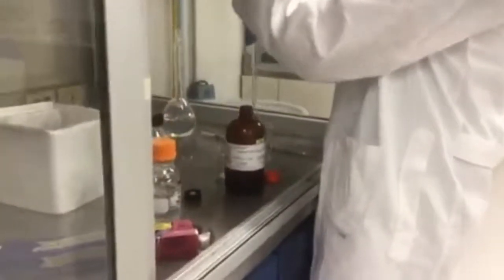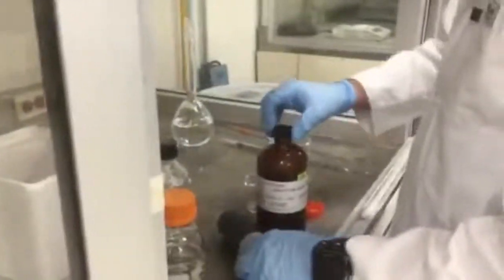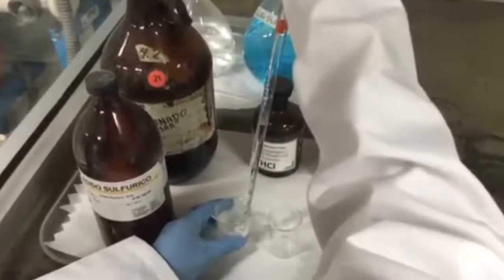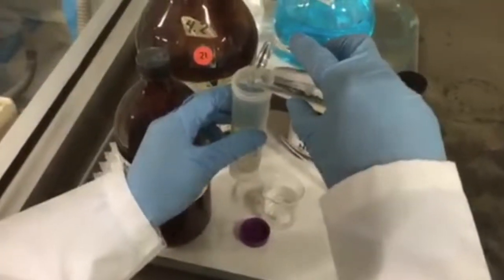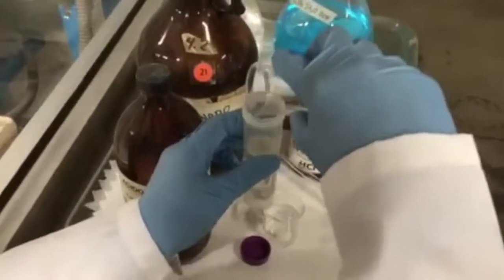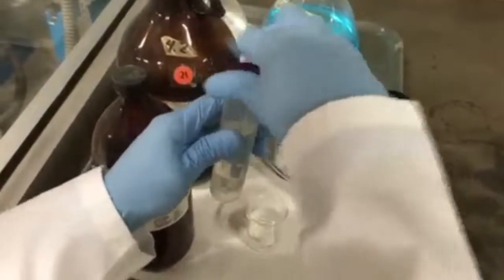Some of the things that should be taken into account when preparing the solutions are: not all the glassware is precise, so the use of a volumetric flask is important to achieve an optimal concentration. If the reactants are old or mis-stored, they won't be as pure as expected. The order of the solute addition in pH-specific solutions is important. When working with solutions that are acid or basic, the following should be taken into account: use of gloves, fume hood, and clean glassware. Some reactants are thermosensitive, some reactants are photosensitive. The glassware will not always be properly cleaned and stored, so it should be washed before use. When the solutions are pH specific, there should be constant stirring to have a homogeneous solution. The stirring magnet size depends on the glassware being used. Correct labeling of the solution should be done to avoid mishandling.